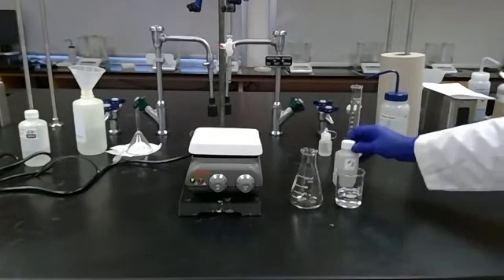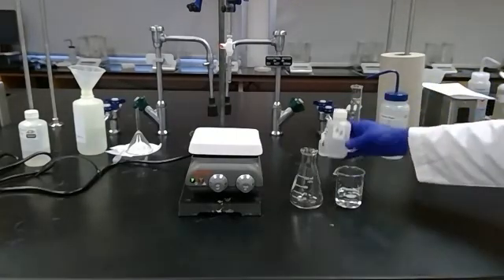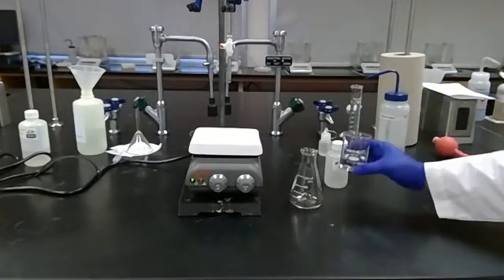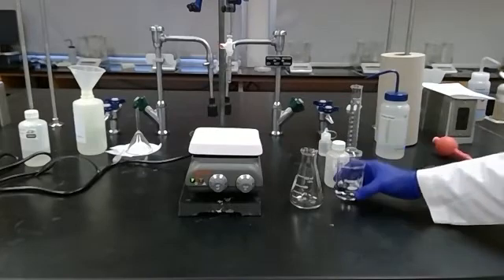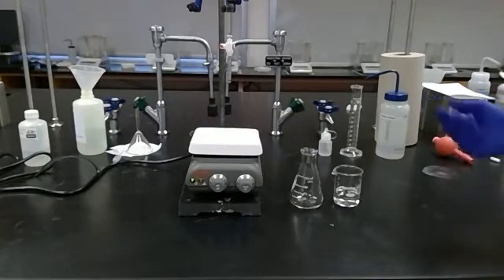So now that I've standardized my base, it's time to use it to titrate an unknown acid. I've chosen unknown acid number two and I've poured about 40 milliliters into a beaker so we don't contaminate the solution in the bottle.